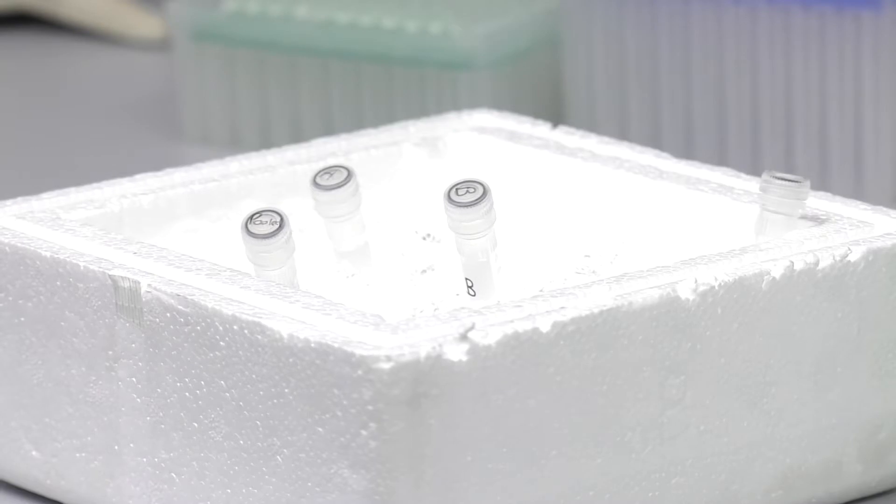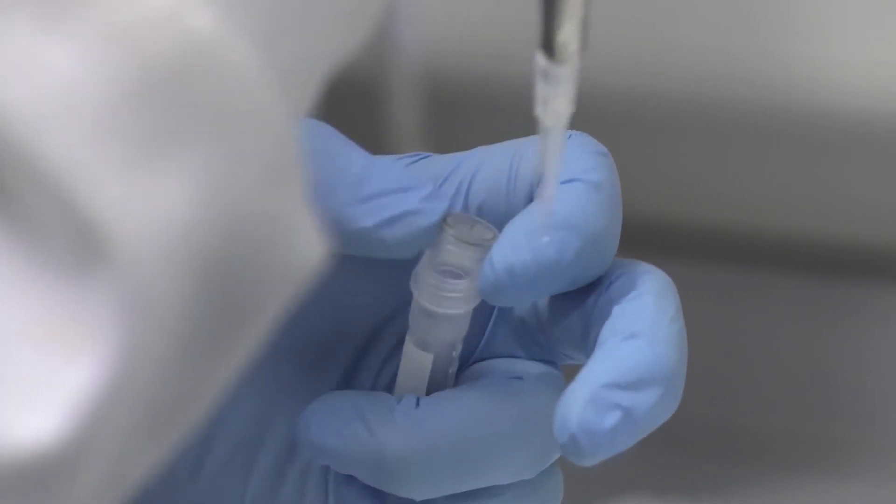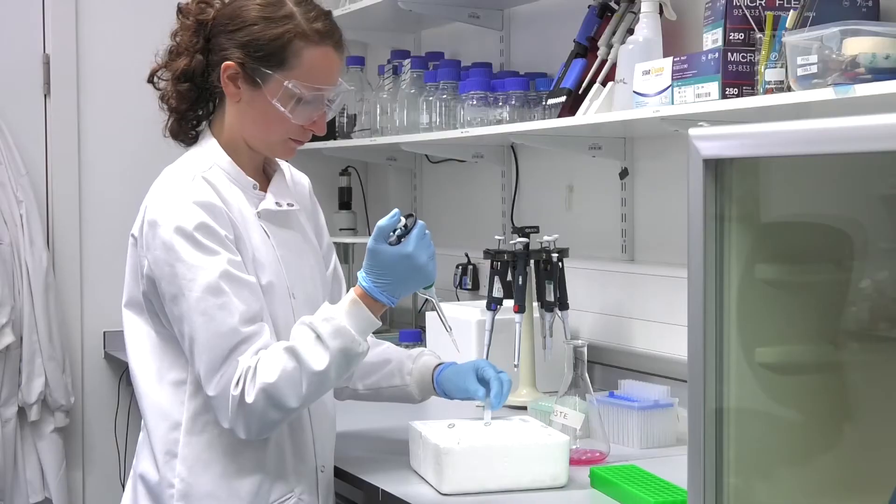Step 8. Create a pooled sample with an equal volume of material from each sample, ensuring a minimum final volume of 500 microlitres.